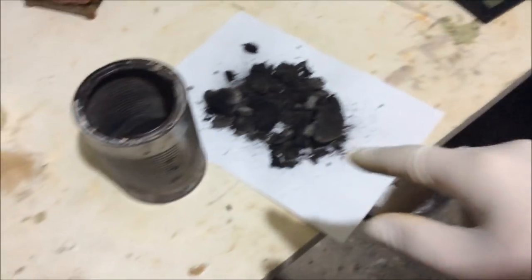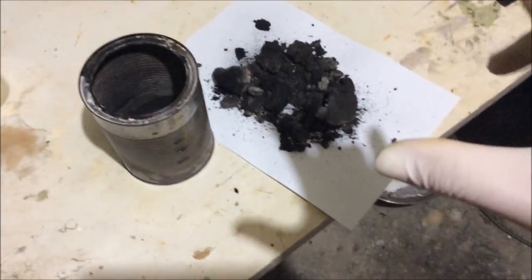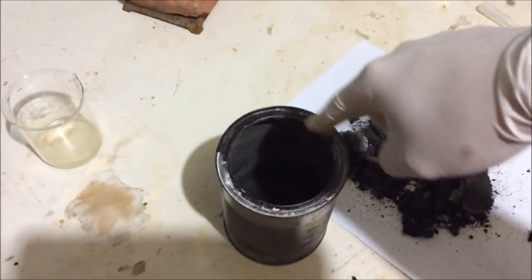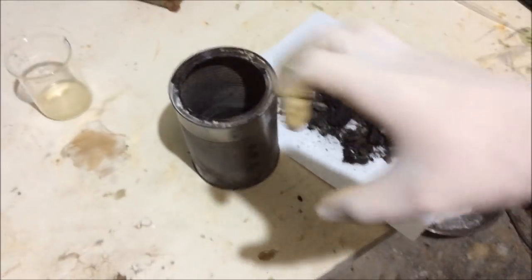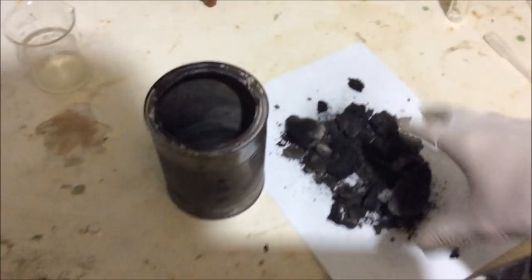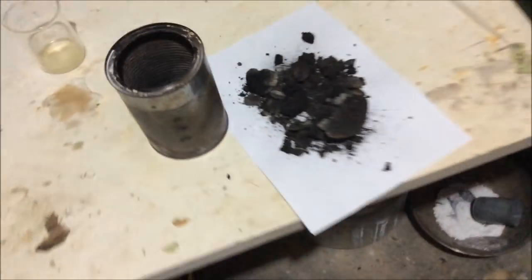There's some lighter patches, but because my first thought when I saw the really slow rate of benzene coming over, I thought that it wasn't getting enough heat transfer, like I was just decarboxylating the bits around the edges and down the bottom, and there was going to be a big mass in the center that wasn't melted. But by the looks of it, that hasn't happened. It's all charred as heck. But at least I get to reuse this container.